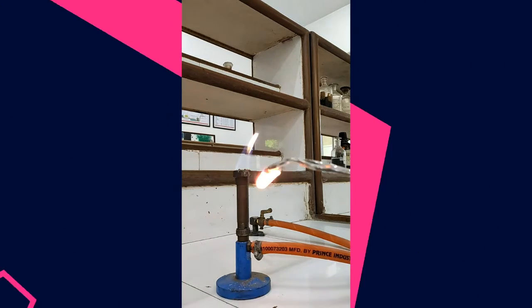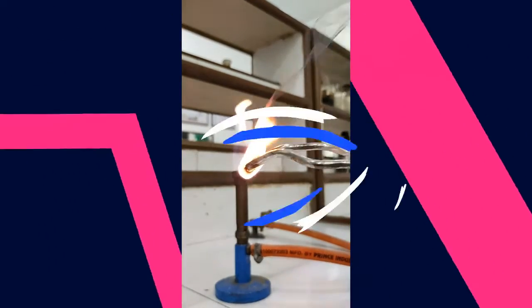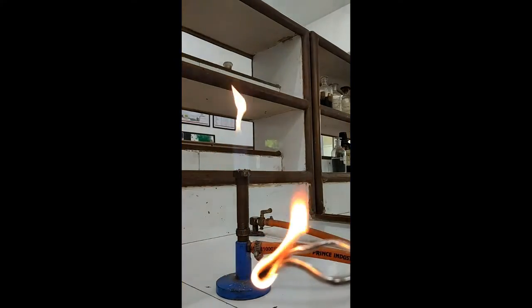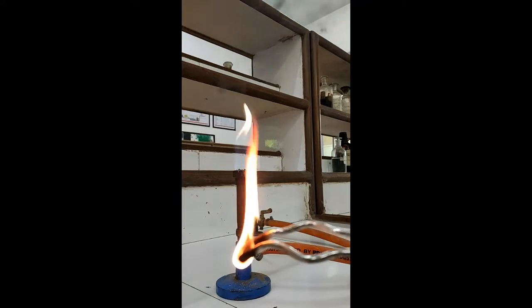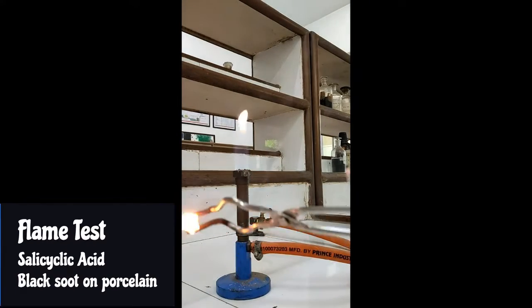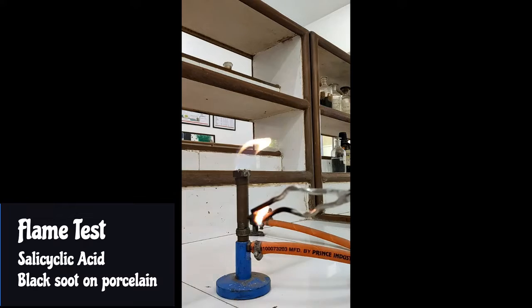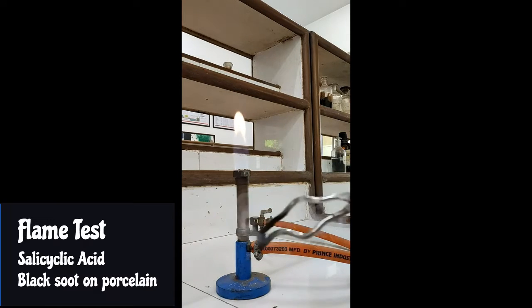You can notice a black colored flame, like a sooty or smoky flame. This black soot further confirms that the compound is aromatic. With the help of a flame test, you will first be able to understand whether the compound is aliphatic or aromatic.